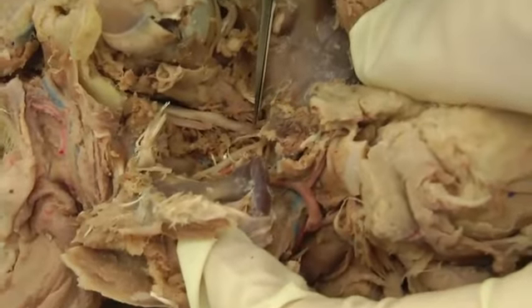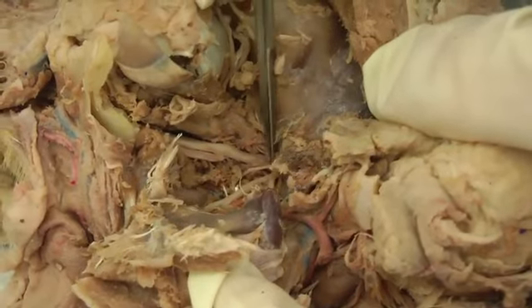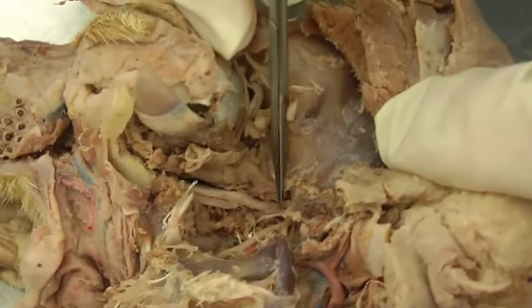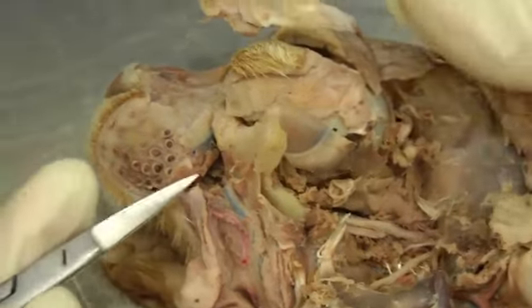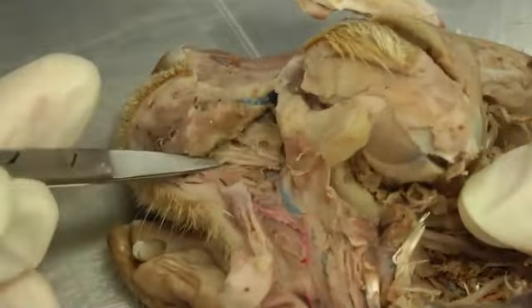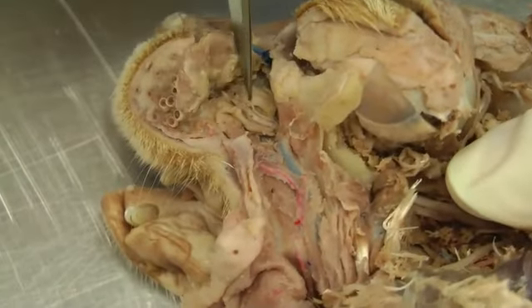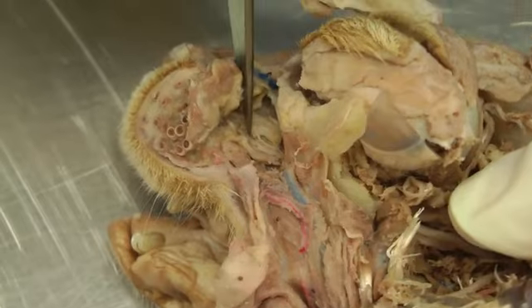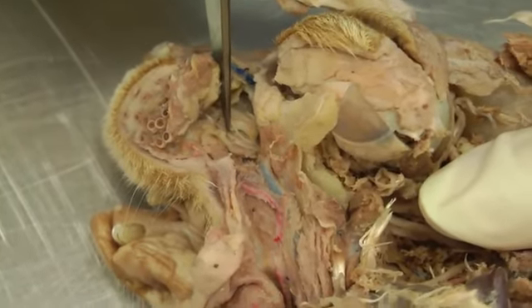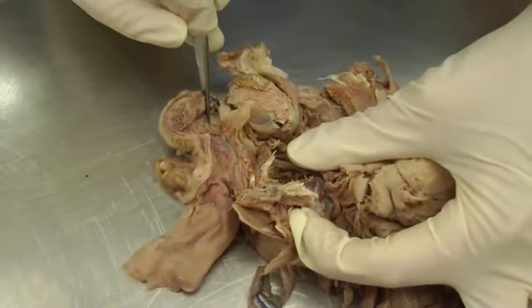Your external ophthalmic would come off back here where it comes out again and go up towards the eye. So if you see something there, maxillary continues, and then it will come out of the infraorbital foramen. Again, it loses its injection, so we can't really see much of anything, but it's this little thing right here. So infraorbital artery at that point coming out with infraorbital nerve. And that should be it for Lab 25.